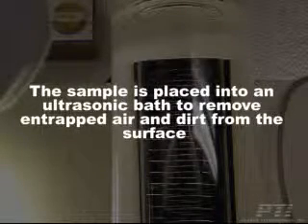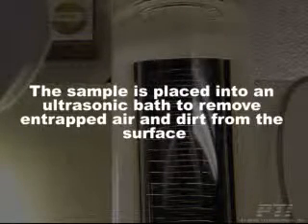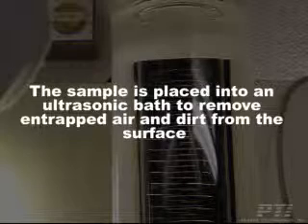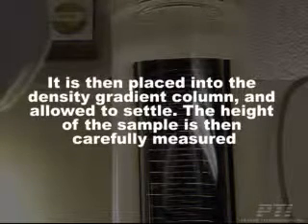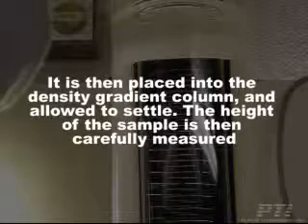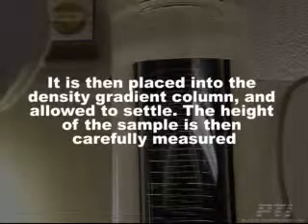The sample is placed into an ultrasonic bath to remove entrapped air and dirt from the surface. It is then placed into the density gradient column and allowed to settle. The height of the sample is then carefully measured.